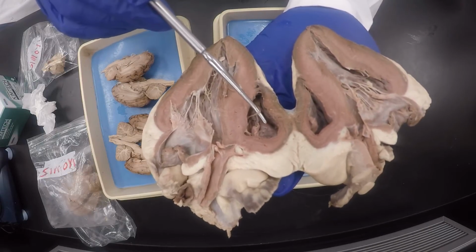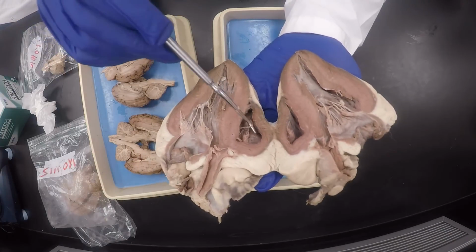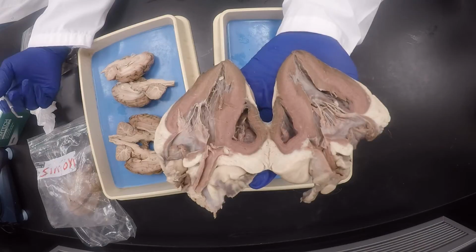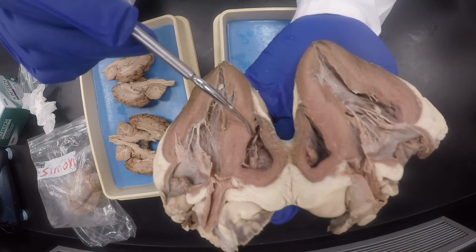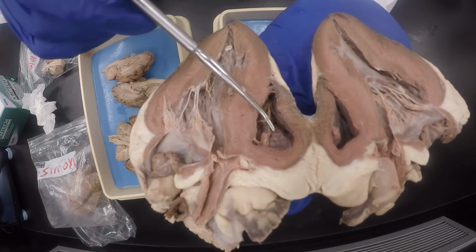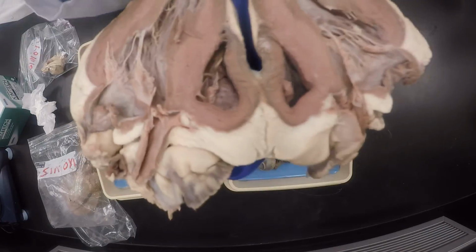And you could confirm this is the right side because of this band here, you see, which is called the moderator band. Okay, so I also called it the septomarginal trabeculae, but in the exam we just call it moderator band. It's so much easier to spell too, and it's on the list. Okay, it's on the right side, moderator band. If I say what's that string-like structure, and it's on this one, usually the string-like structure is much bigger than this. Okay, it's fatter than this. Okay, but on my heart for some reason it's smaller, so it's okay, you know.